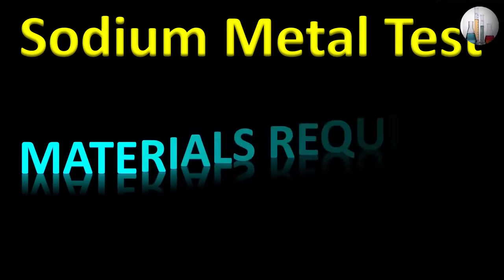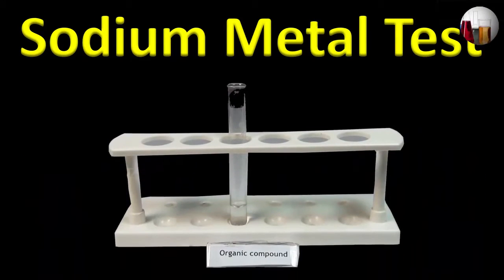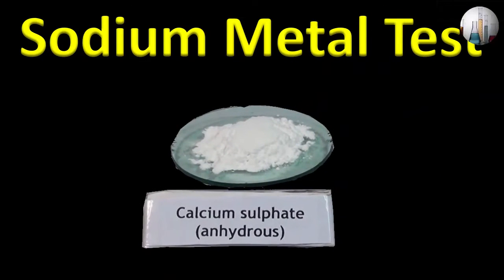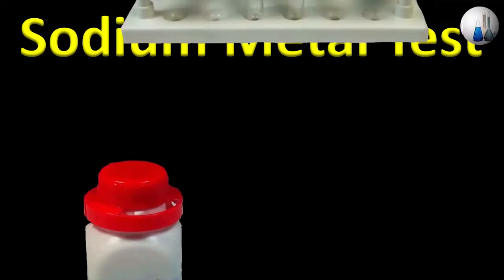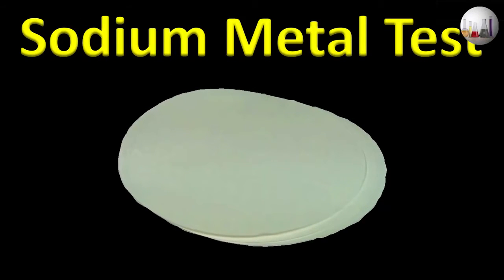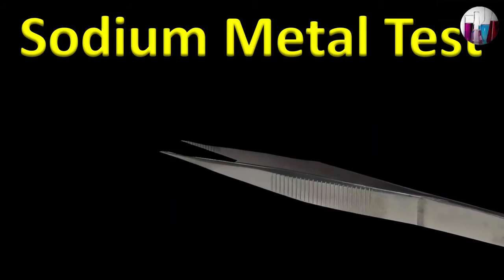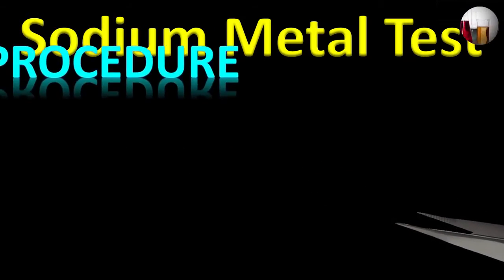Materials required: organic compound, anhydrous calcium sulfate, sodium metal, test tubes, funnel, filter papers, spatula, and forceps. We will now demonstrate for you the procedure.